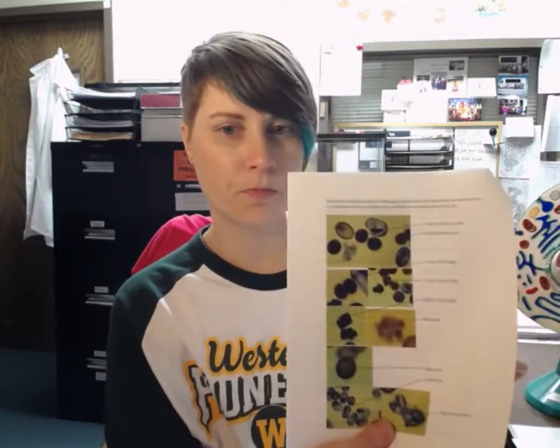And then we also had to know, remember we learned about the development of the sea star. So definitely make sure that you can identify the stages that you had to draw. So you had to do the unfertilized, the fertilized undivided egg cell or ovum. And remember, they look like they're just shaded in. Oh, I'm pointing at it and I'm not showing you, sorry.